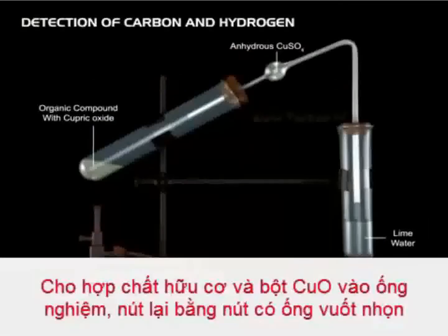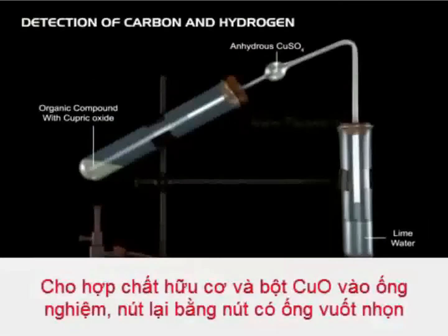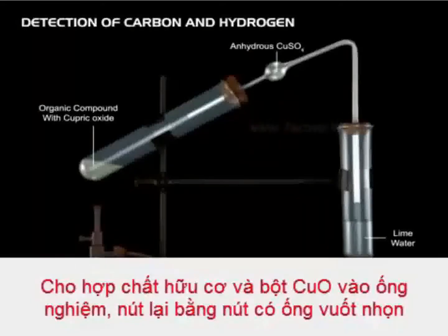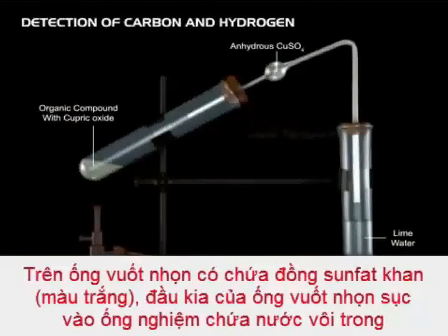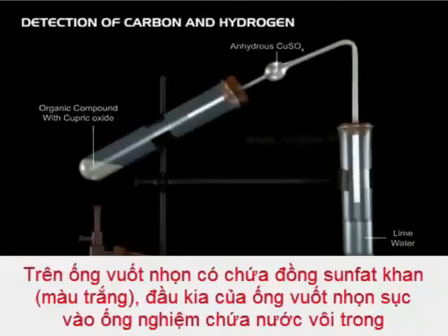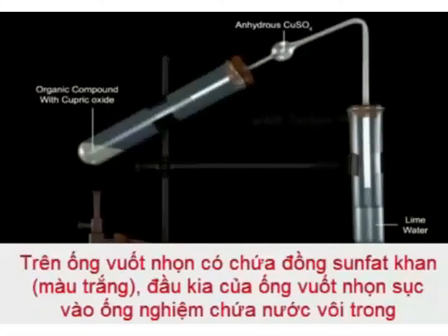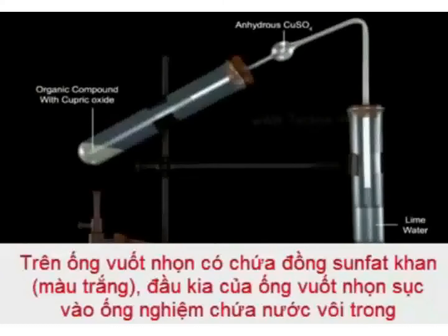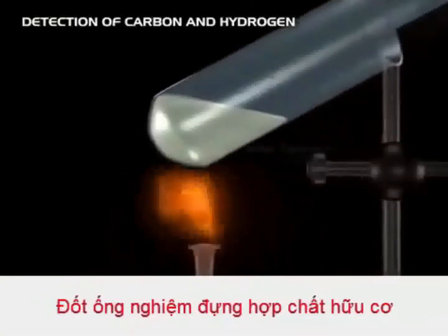Take the organic compound in a dry test tube and mix it with cupric oxide, CuO, three times its weight. Heat the compound strongly.